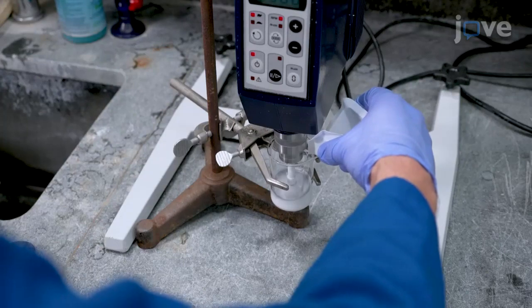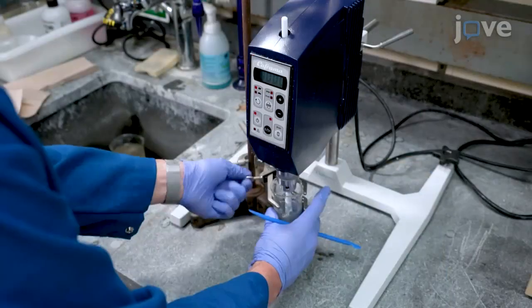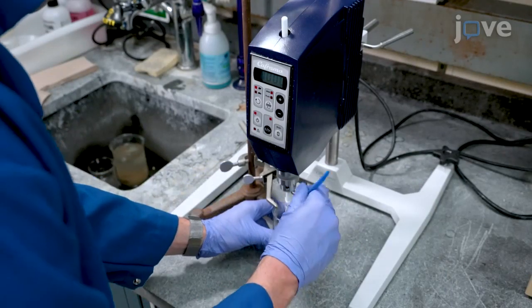Add 50 grams of zinc powder and continue stirring for 5 more minutes. After 5 minutes, stop the stirrer and remove the beaker.